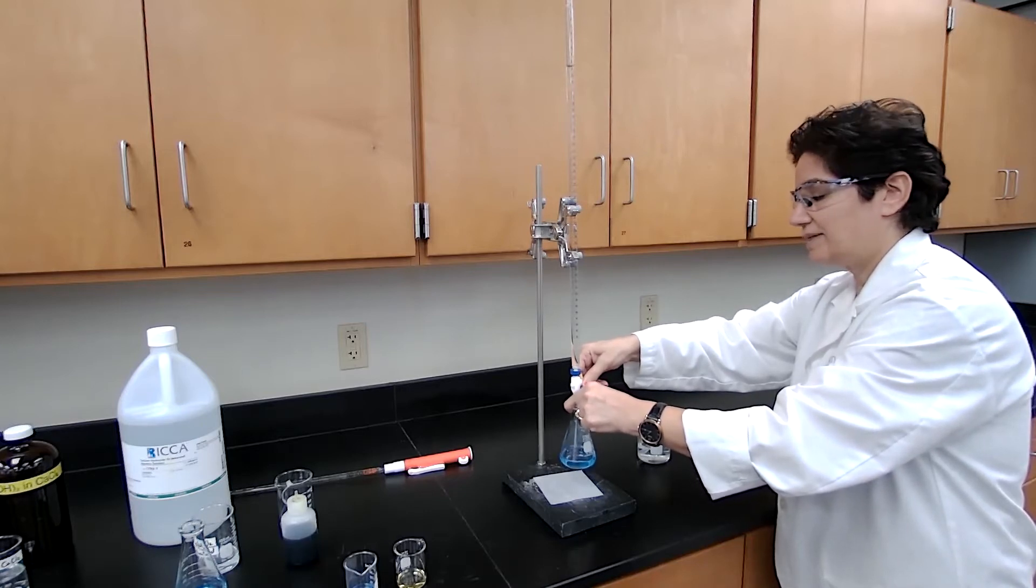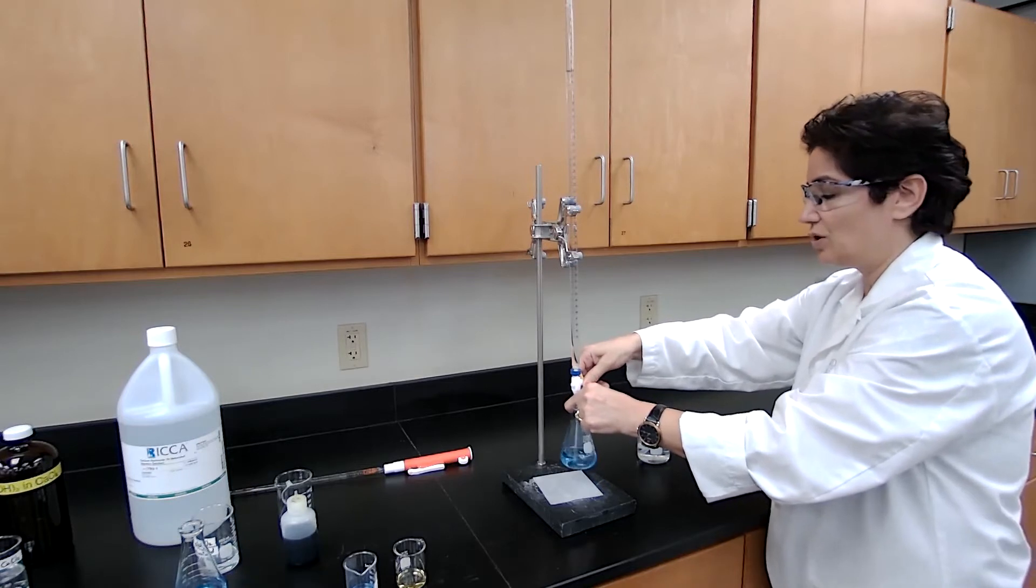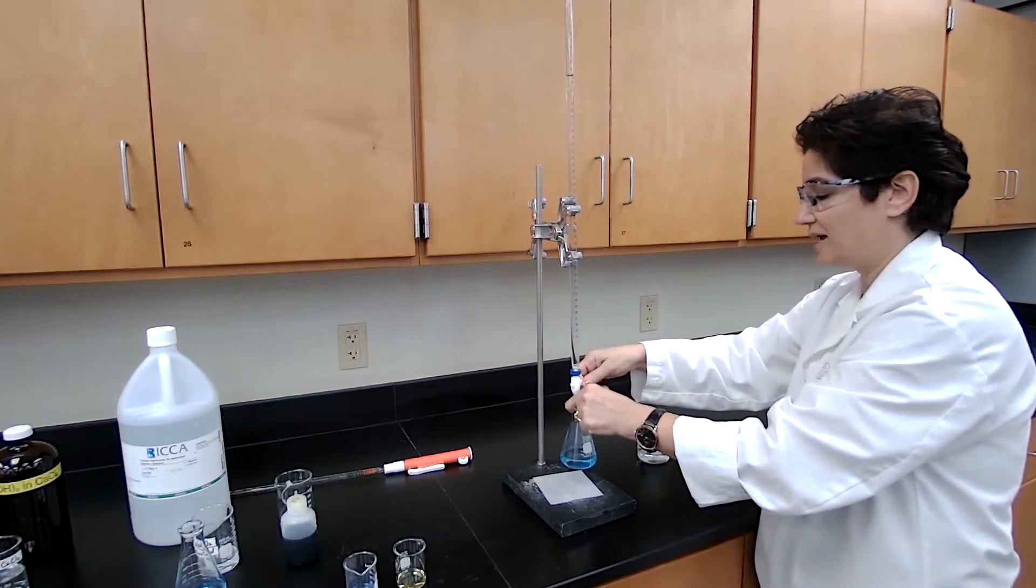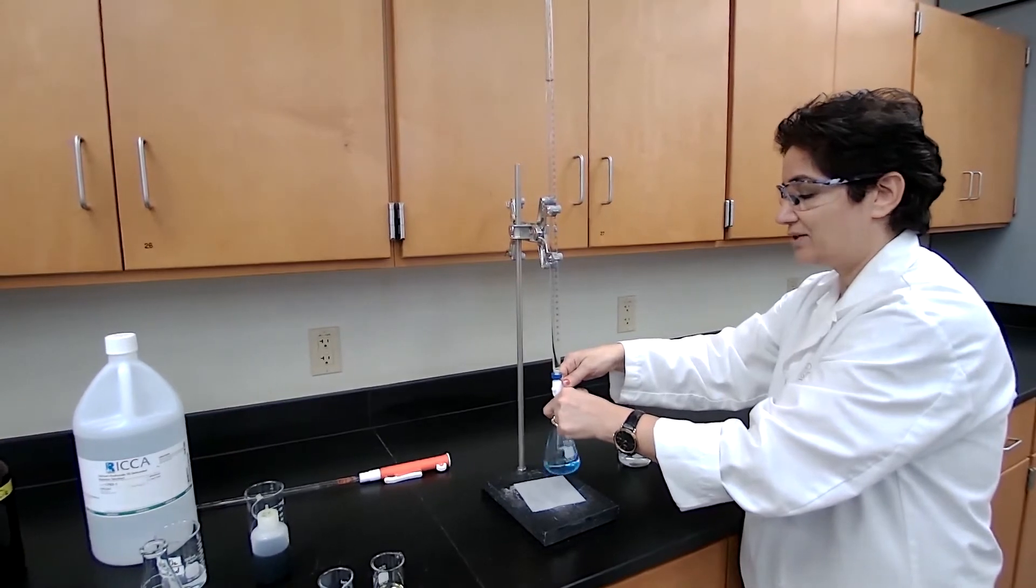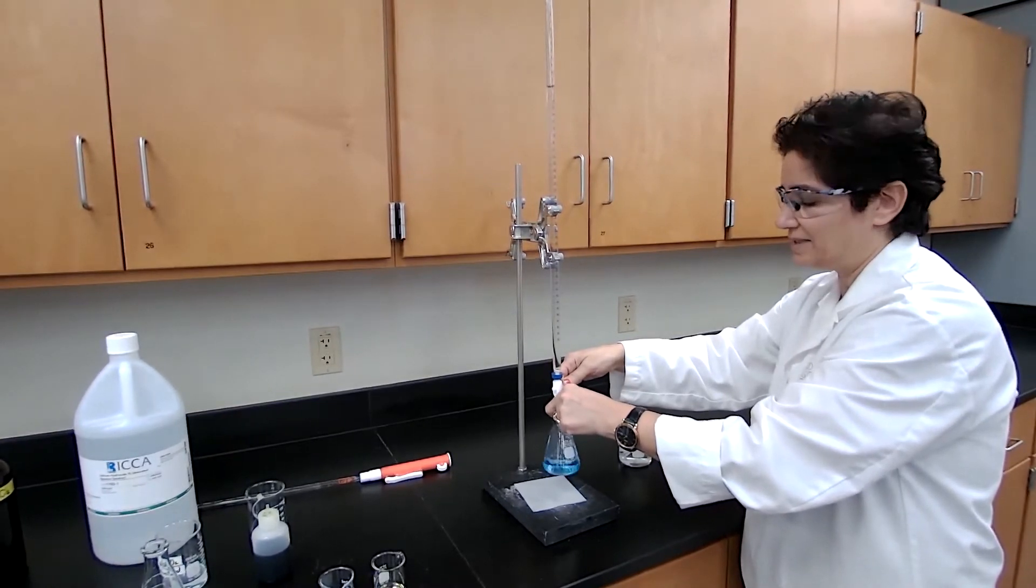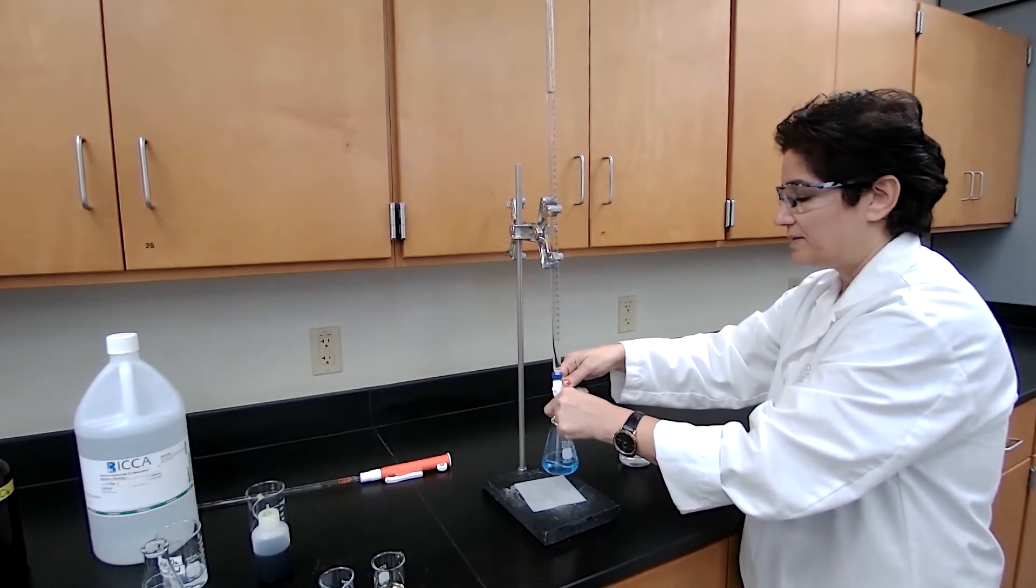The first trial is always hard in titration because you don't know approximate value or how much of the volume of the standard is going to be used. The second one is easier. So I keep adding.